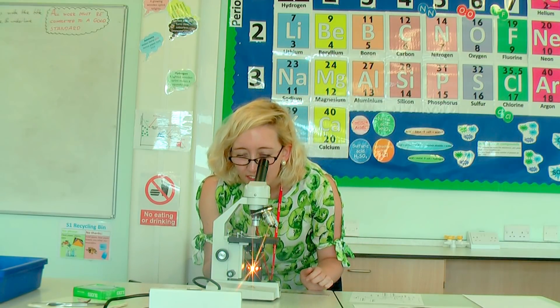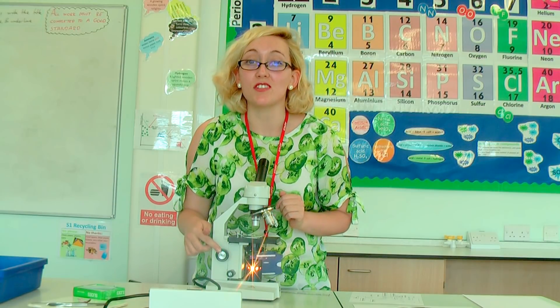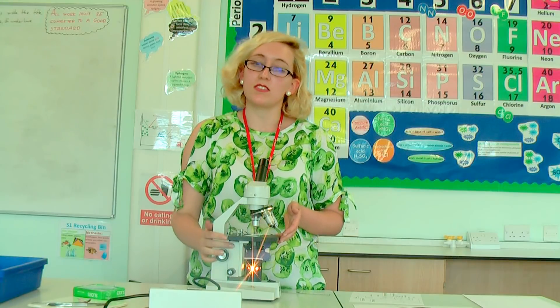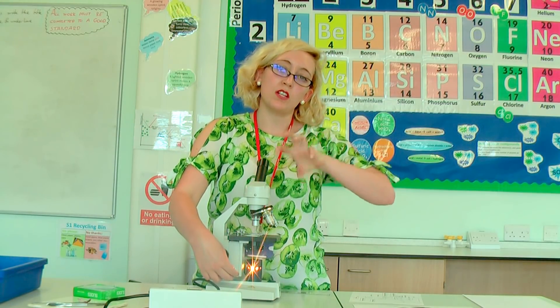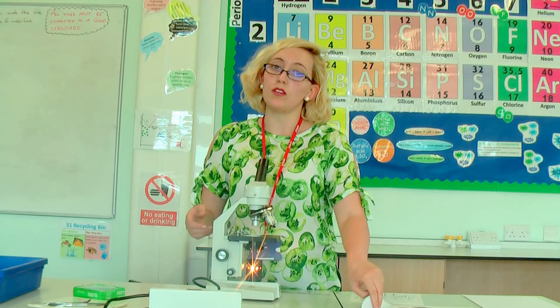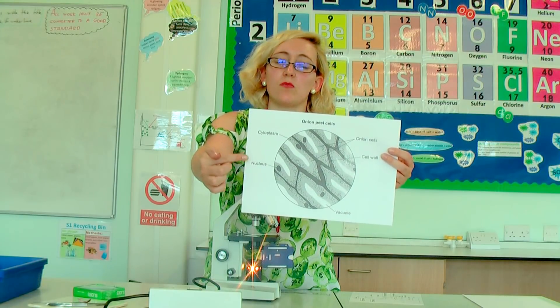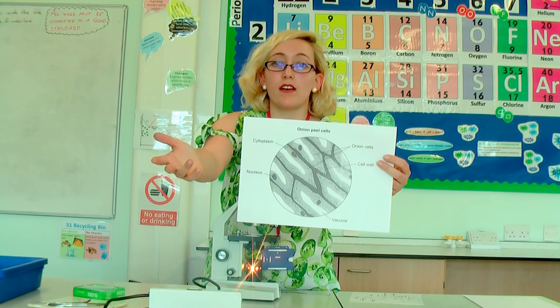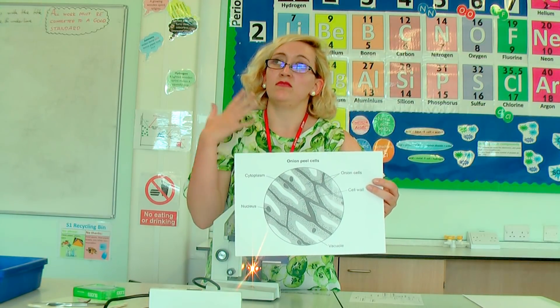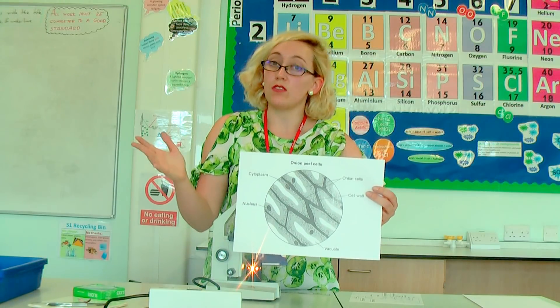Turn the lamp on and you should straight away be able to see something. I'm going to look down — it's massively blurry, pretty much just looks white. So I need to use my adjusting knobs. We've got a big one — that's the coarse adjusting knob — for moving it up and down quite a lot. And there's a fine adjusting knob for fine-tuning. When you have managed to focus, you should see some cells. You should be able to see cell walls, a few nuclei, and some cytoplasm. Don't expect to see any other structures typically associated with plant cells — it's pretty difficult without a more powerful microscope or better staining.